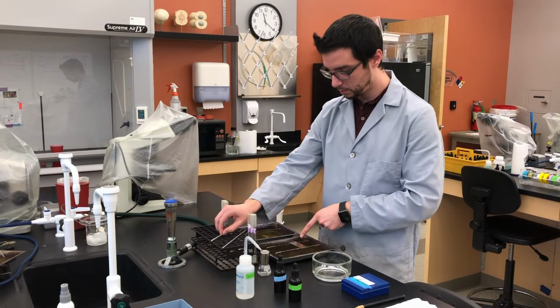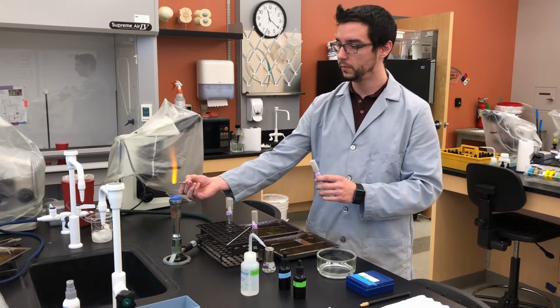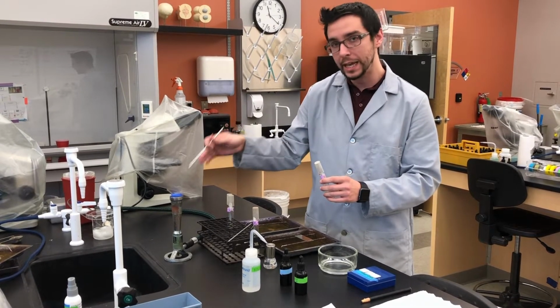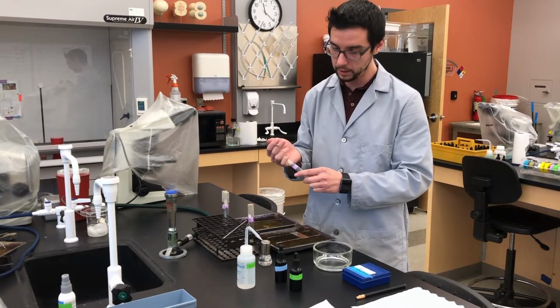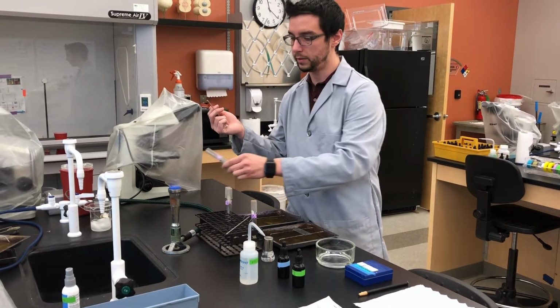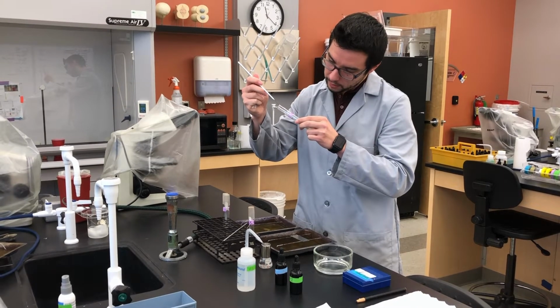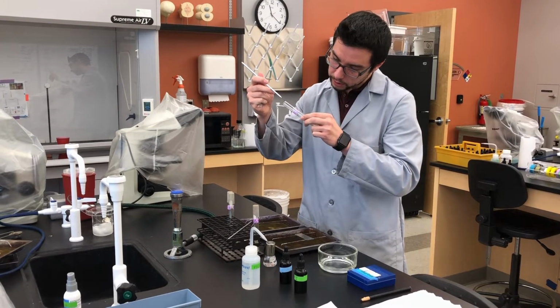I'm then going to read my label, find the appropriate culture, sterilize my needle. And again, the important reminder here is that you do not need to scrape off culture. Just barely kiss the edge of where you see bacterial growth. You do not need a ton for this. Okay, so let it cool. Flame the mouth of the tube. Find the edge of the bacterial culture. And before you touch it, go ahead and touch the side of the tube just carefully. Make sure your needle is cool, and then kiss the very edge of that culture.